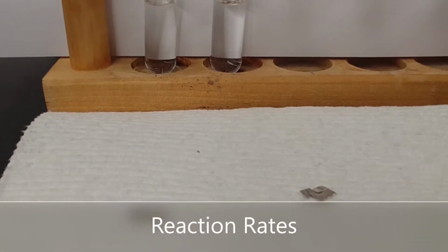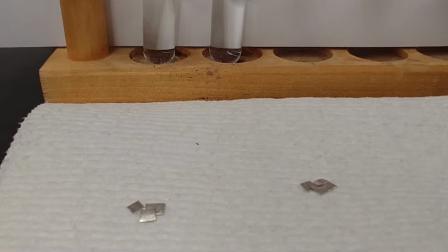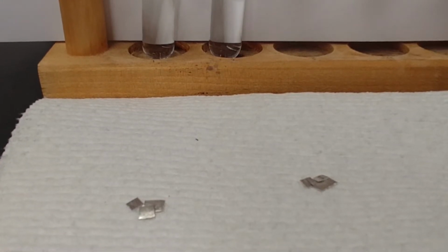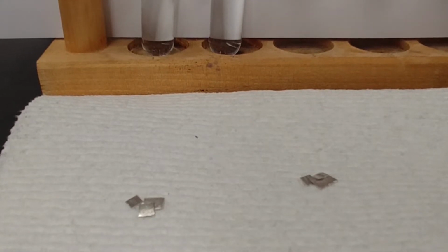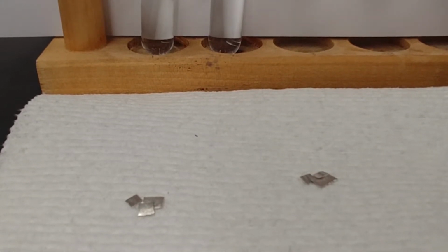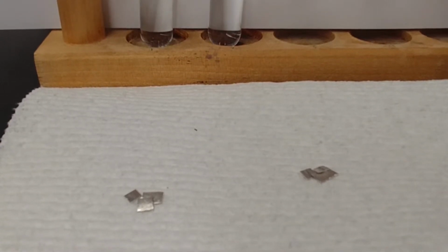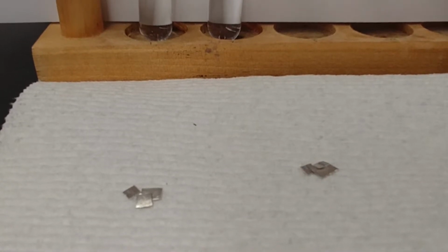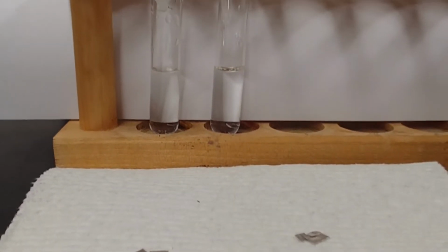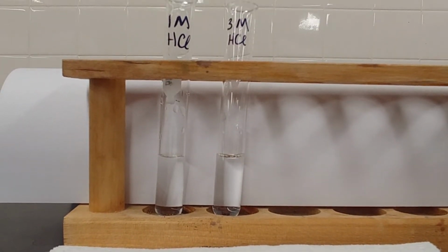Okay, so this part of your lab is a study of kinetics, that is the rates of reactions. We're going to see what causes certain reactions to go faster than others. So what we have here to start us off are some roughly equal size samples of magnesium ribbon. We are going to place those into two different solutions with different concentrations of HCl.